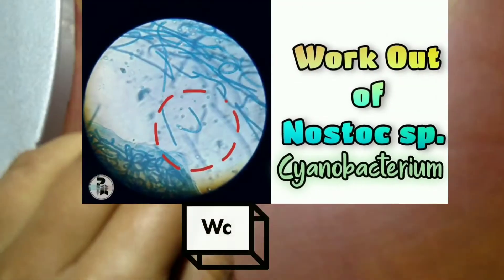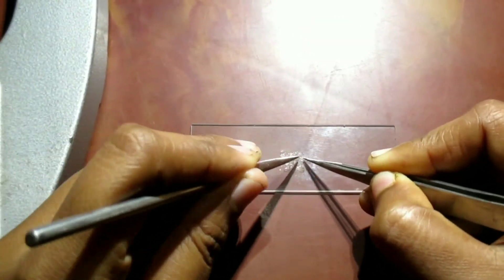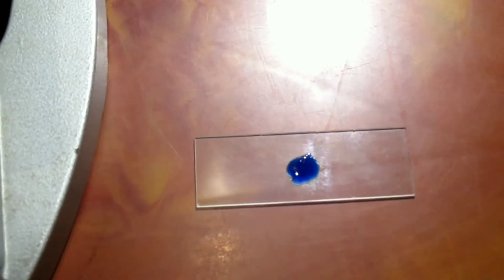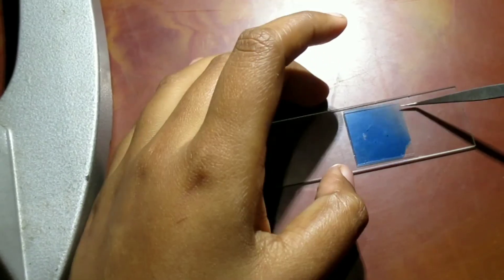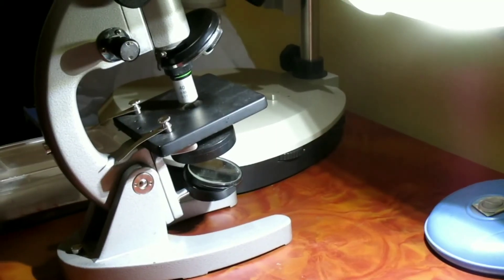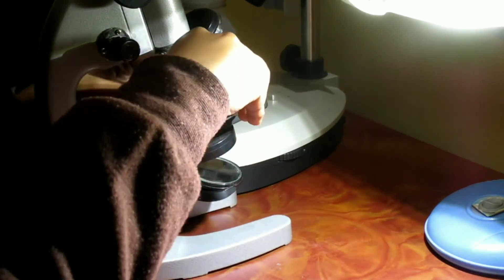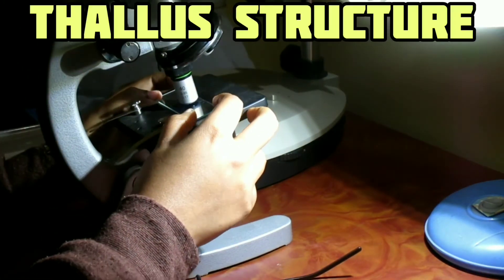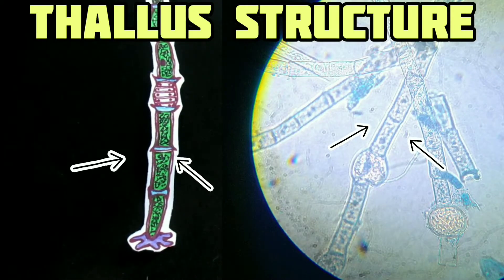The walkthrough is as simple as Nostoc — please check it out in our previous video. Preparing a grease-free glass slide, teasing apart clotted filaments, a little bit of staining with cotton blue, and letting it fix for a few moments. Here we have some satisfactory images to describe its thallus structure.